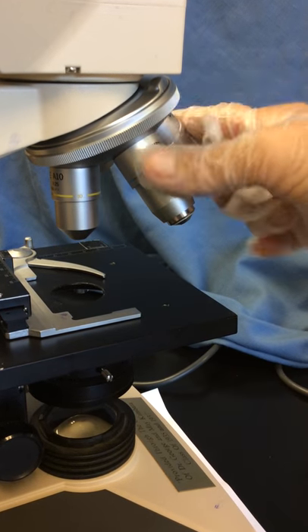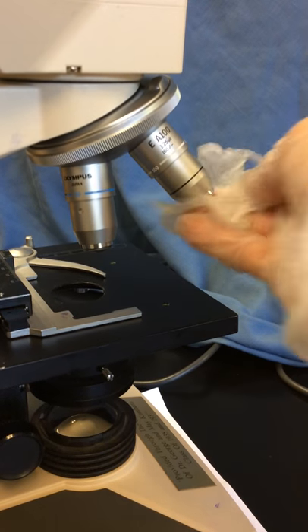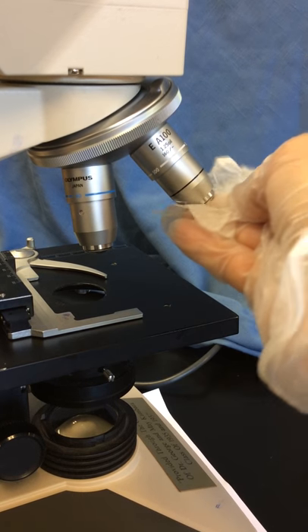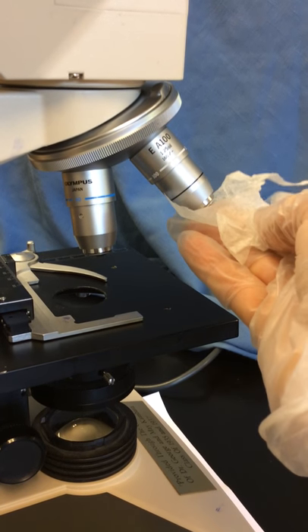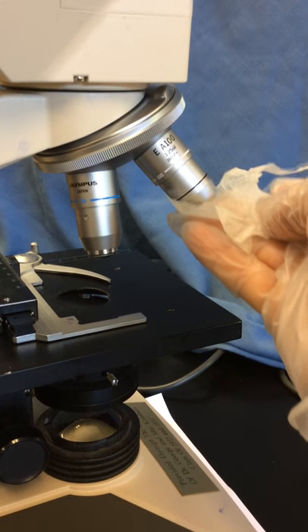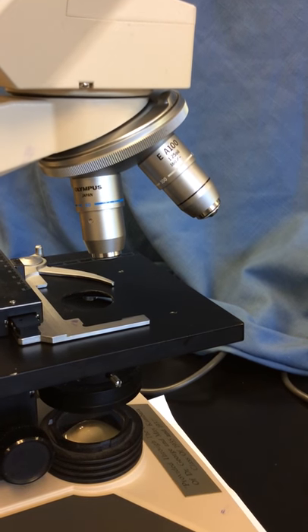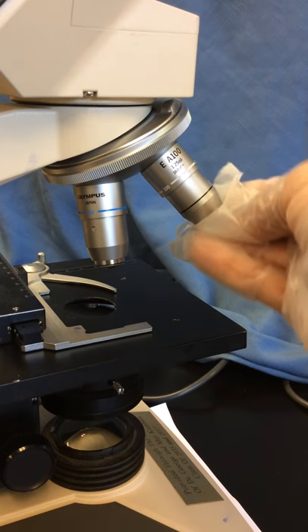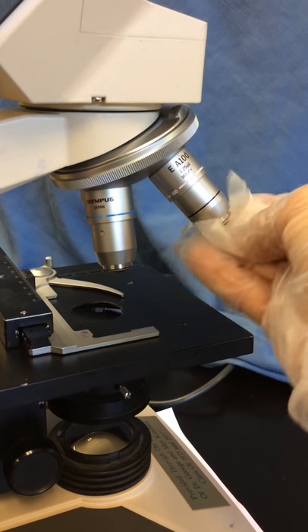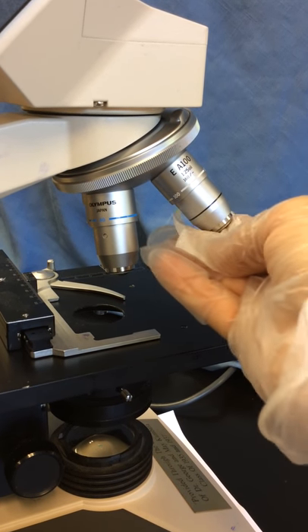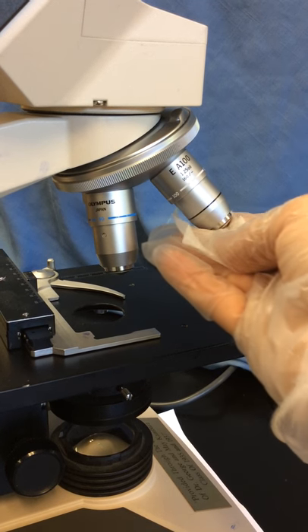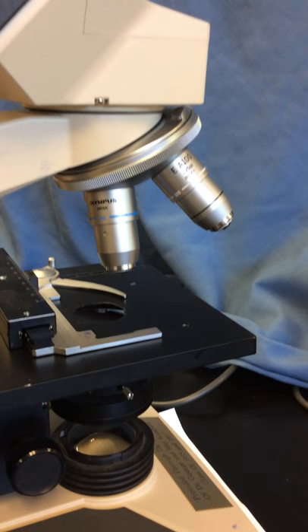Very importantly, if we've been using our oil immersion lens, we want to double check that oil immersion lens and make sure that we get all the oil off. You put a little bit of pressure on the lens, you'll see it retracts. Sometimes there's a lot of oil there, and you'll need to use multiple pieces of lens paper, almost like you're milking the oil out. We don't want to leave the oil there because it will dry and create a fuzzy image.